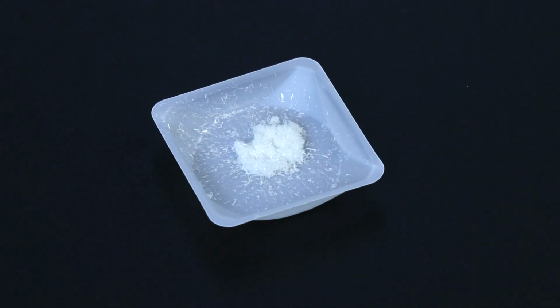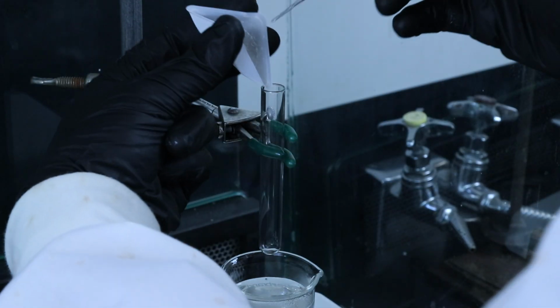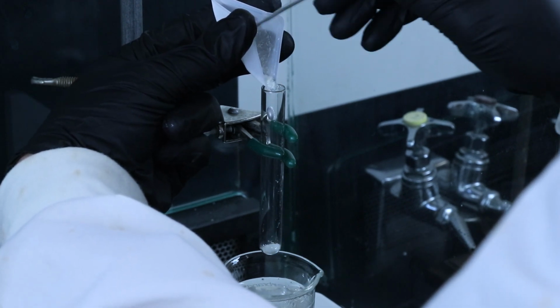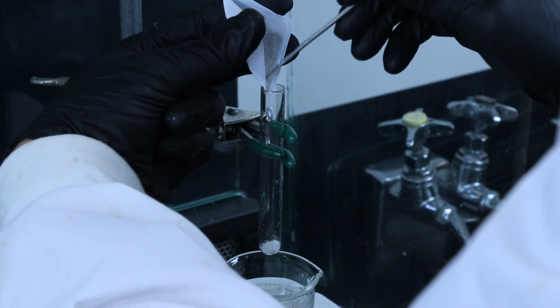I'm going to show how to recrystallize a solid product, and for this video I'll be using the product formed in the photochemical isomerization lab. So this is cis-1,2-dibenzoyl ethylene. You'll want to transfer your crude product over to either a test tube or a Craig tube, depending on how you plan on separating the crystals from the solution once the recrystallization process is done.